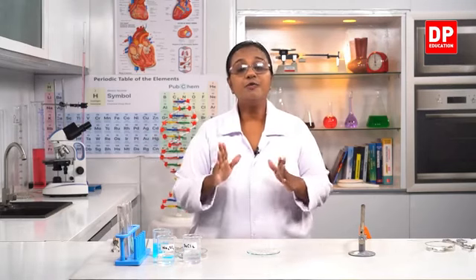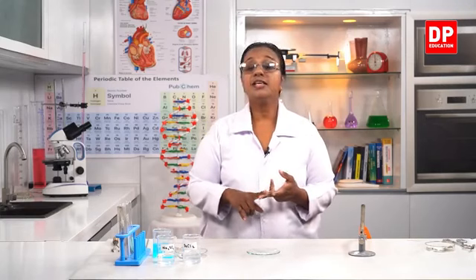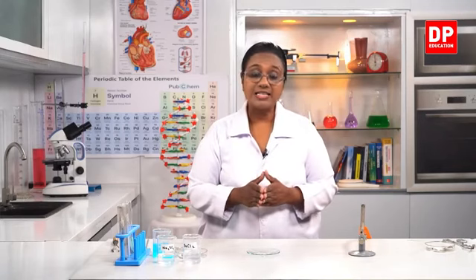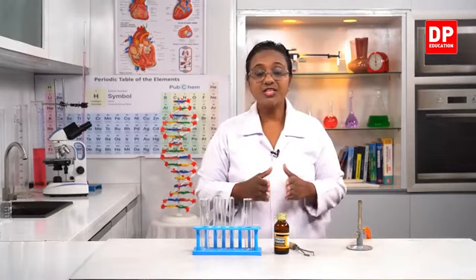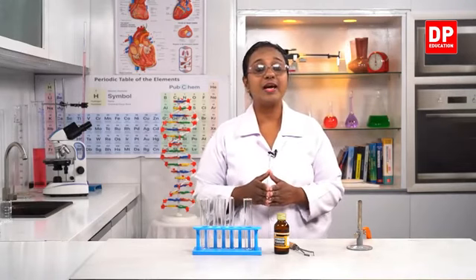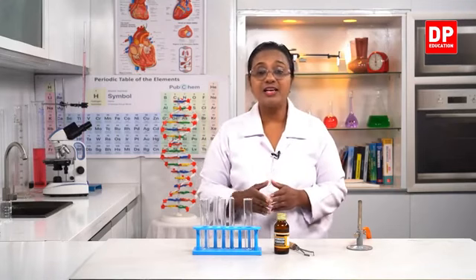So those are the 4 different types of chemical changes taking place: the chemical combination reaction, chemical decomposition reaction, single displacement reaction and double displacement reaction. I am sure now you all can understand the 4 different types of chemical changes. Okay students, now I am going to do this activity again to observe another chemical decomposition reaction. We already observed one, the decomposition of potassium permanganate. On heating, potassium permanganate decomposes to produce potassium manganate, manganese dioxide and releases oxygen.